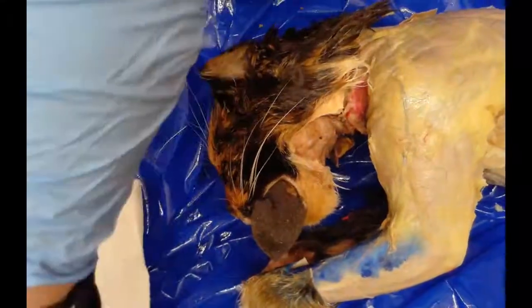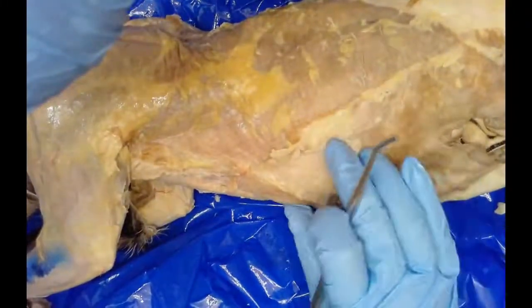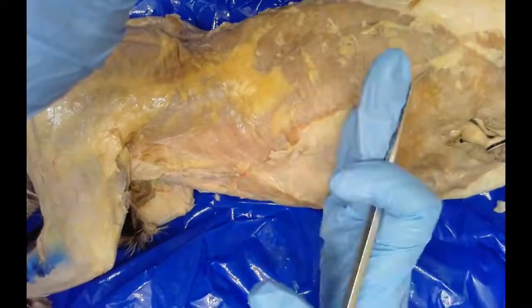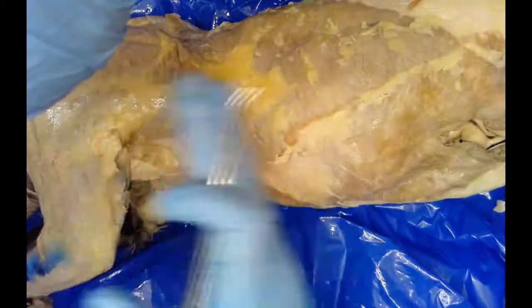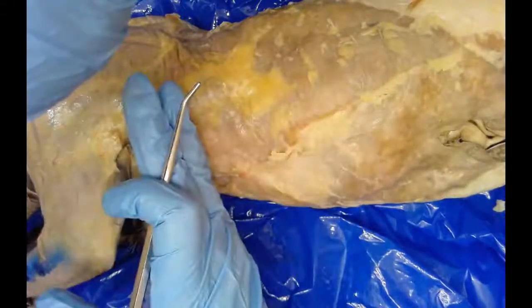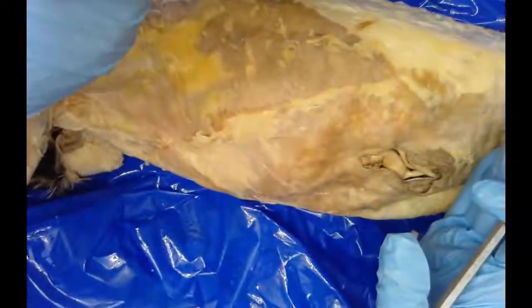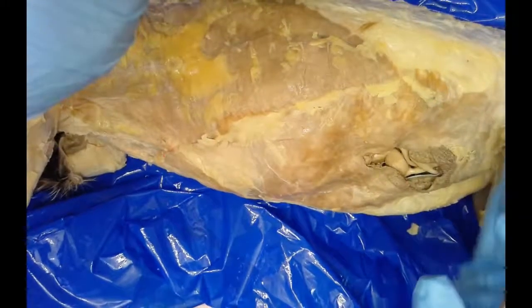Moving on down to the trunk, we can divide it into two sections. I can feel where the edge of the ribs are, right around here. Anterior to the ribs, this area would be the thorax cavity. And then below that, or posterior, that would be the abdomen — the area not covered by the ribs.